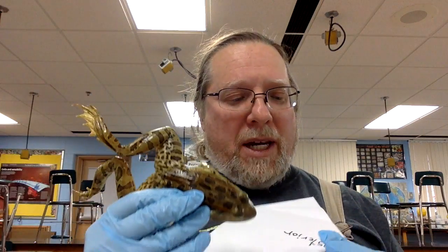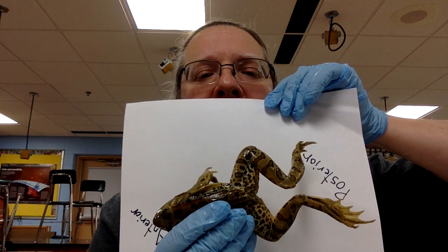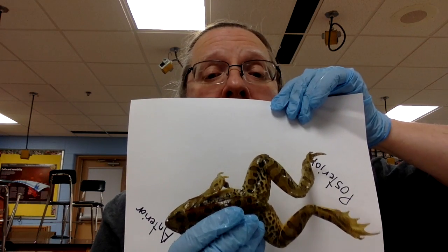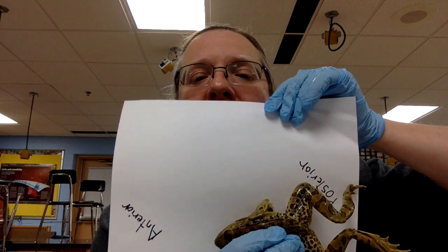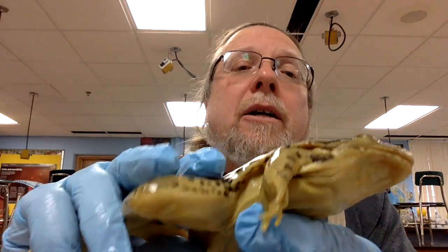Some other orientation words that can be useful: as the frog moves forward, that direction is called the anterior side. Looking at its rear end, that is called the posterior side. Hopefully that will help with talking about orientation of the frog. As I look at the dorsal side, it has two prominent eyes located relatively toward the top of the head — much more toward the top than my eyeballs are. Mine are very ventral-facing, whereas these are dorsal-side eyes.